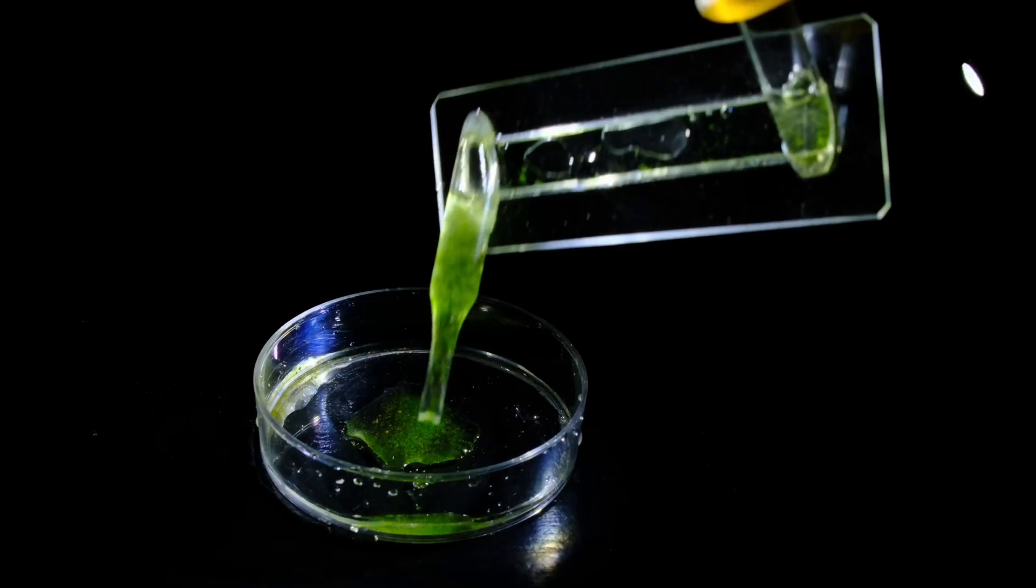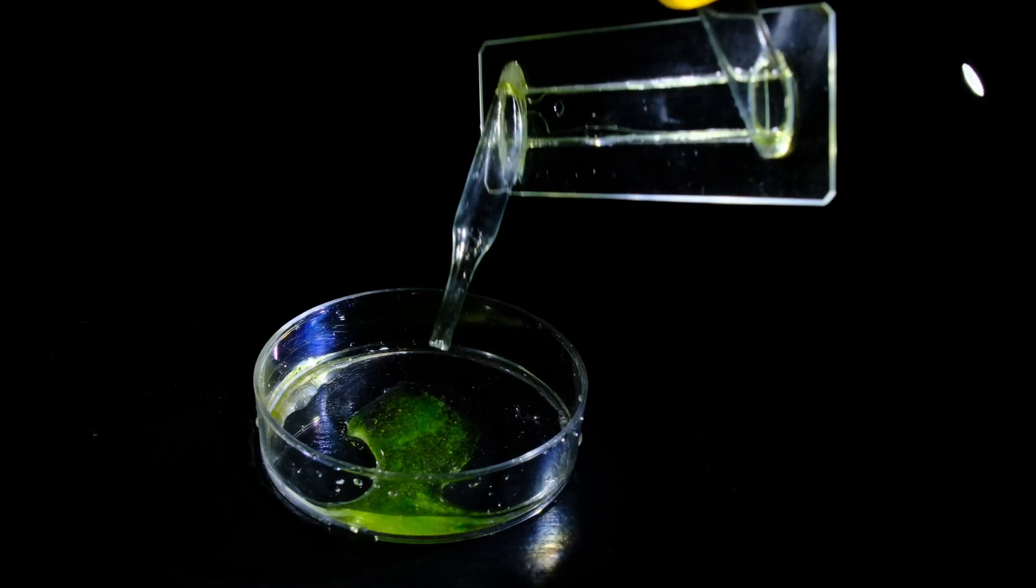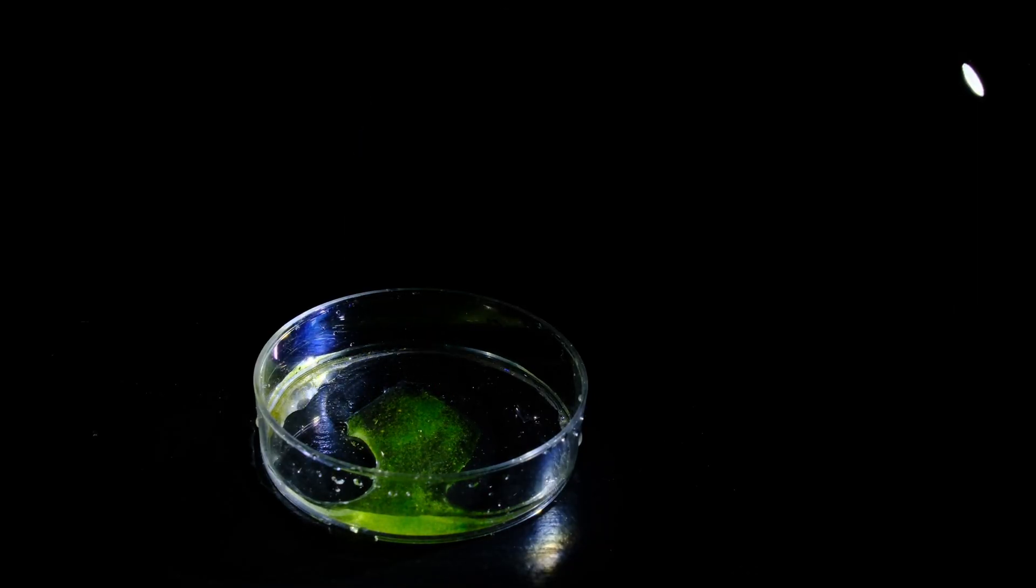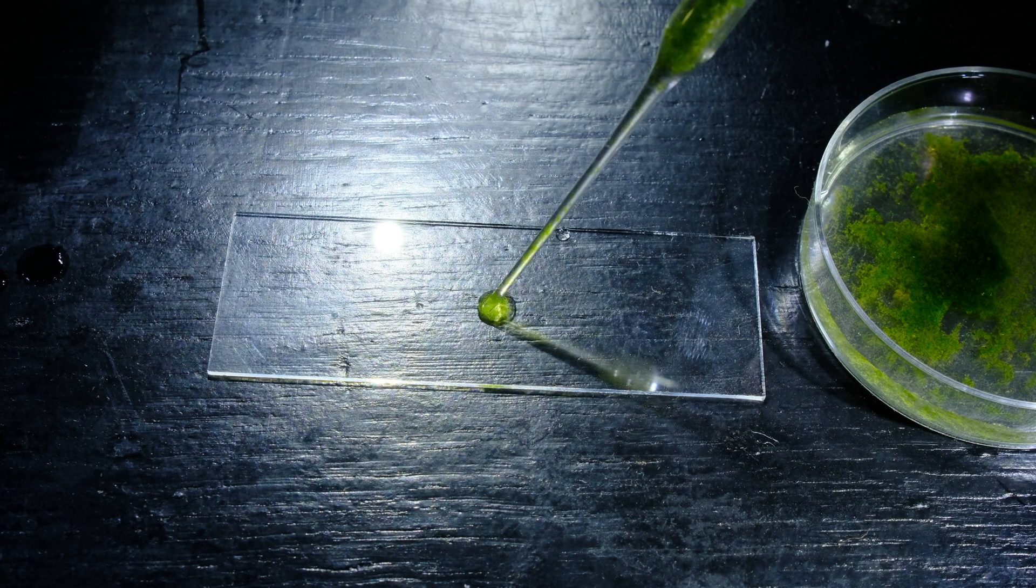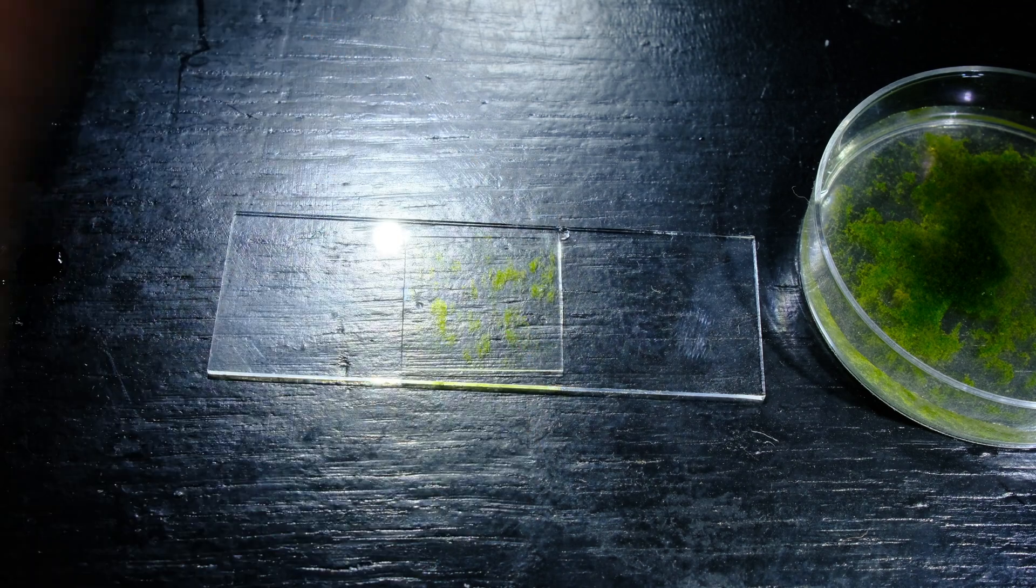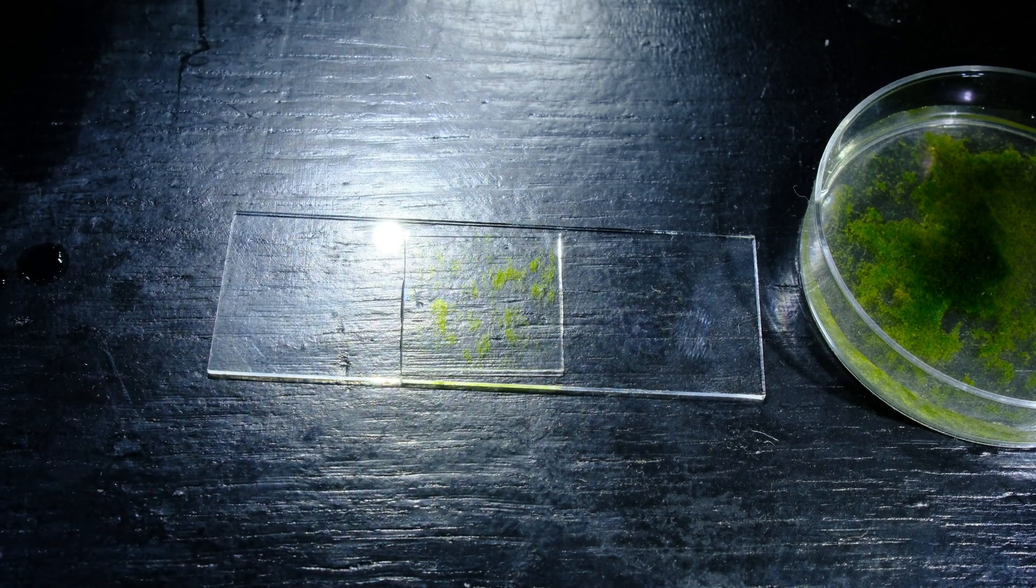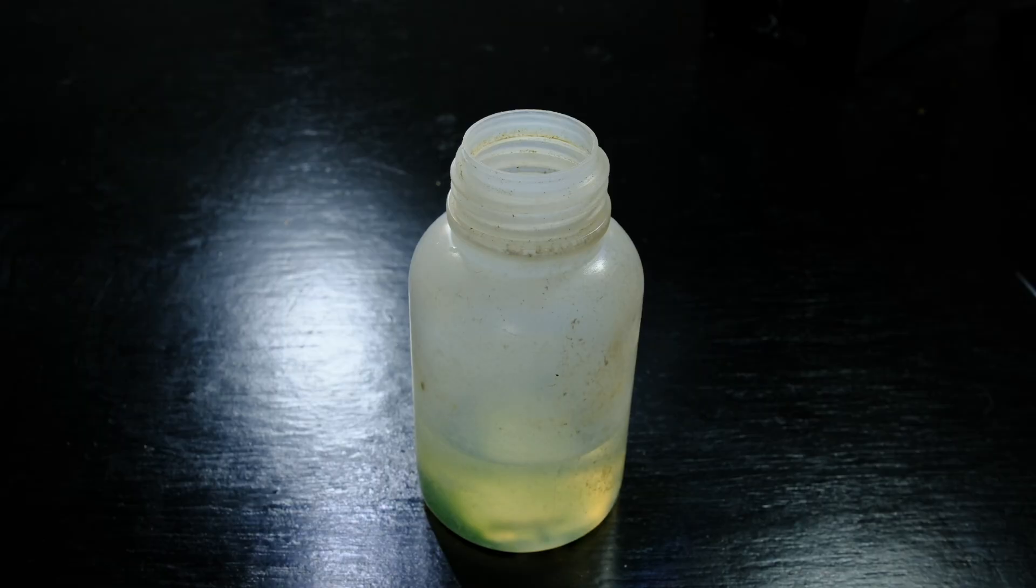After screening, you can transfer the contents of the slide, which, as I told you, is exactly one milliliter of liquid, onto a slide or into another container, and you can isolate everything you desire to examine closer. This makes the frankenpipette extremely practical.